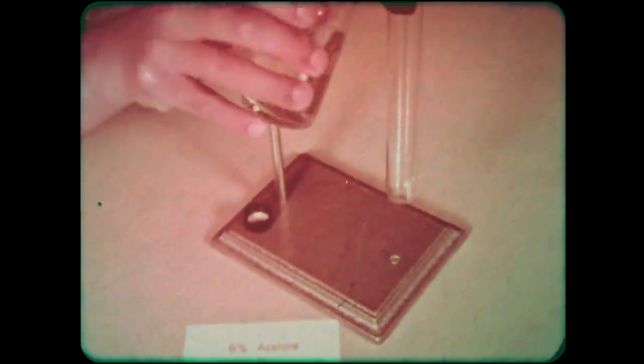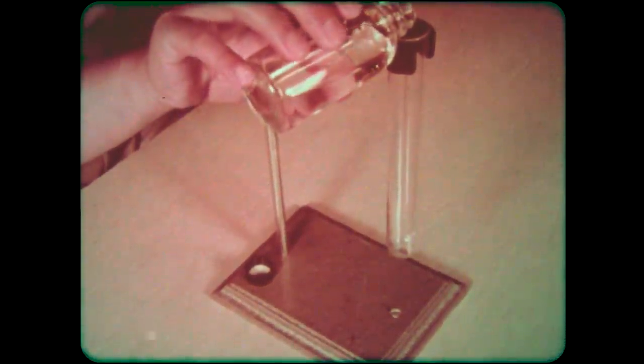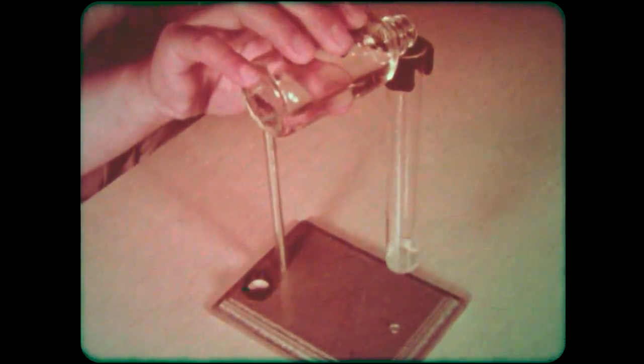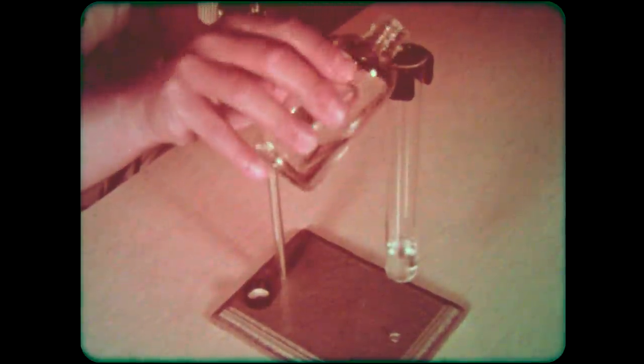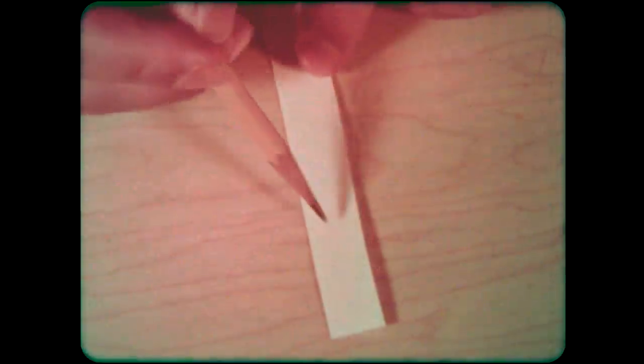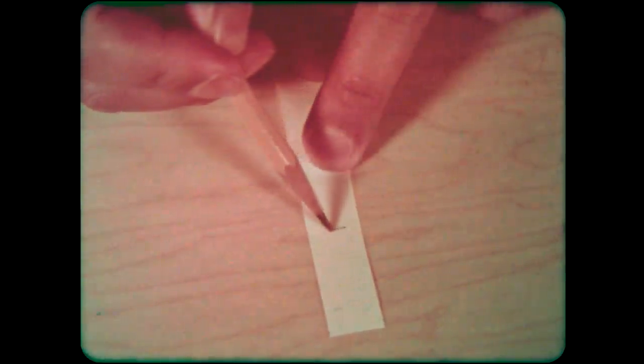Now eight percent acetone and petroleum ether is carefully poured into a large glass tube. This gives another improvement: a saturated atmosphere. On the filter paper strip, a pencil line is marked one inch from the end and on this is spotted the chlorophyll extract.